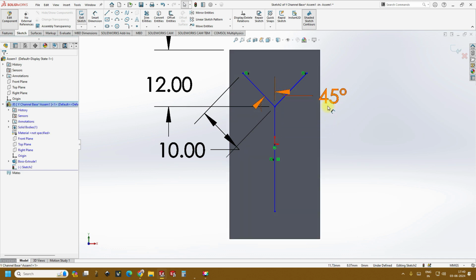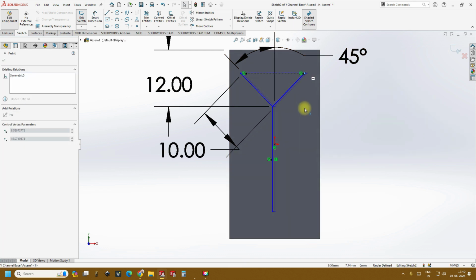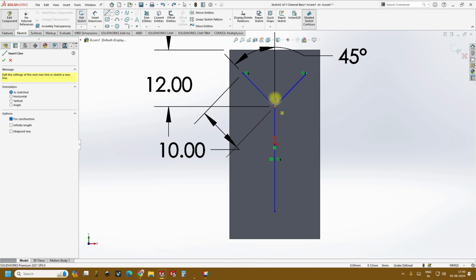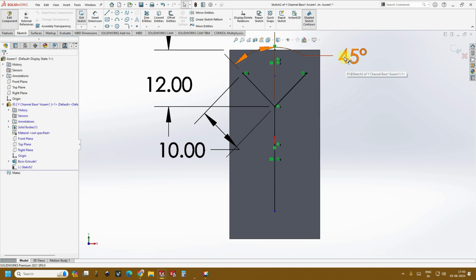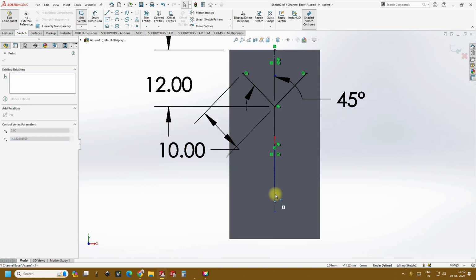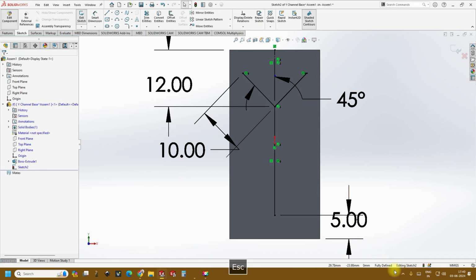Okay, see, it's again mismatched. So to avoid that, you just try to pull. You see that it is moving because there is no constraint in the center axis. Just create a center line, so it is automatically constrained, and then you see this thing has no constraint, and similarly we'll constrain this point with this line somewhere around 5 mm. So now if you see, again the sketch is fully defined.